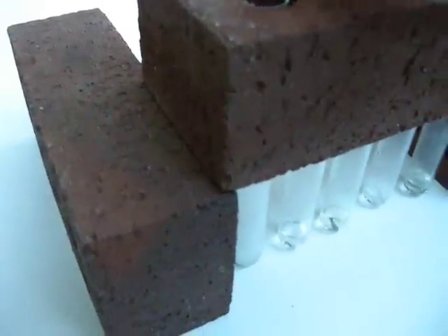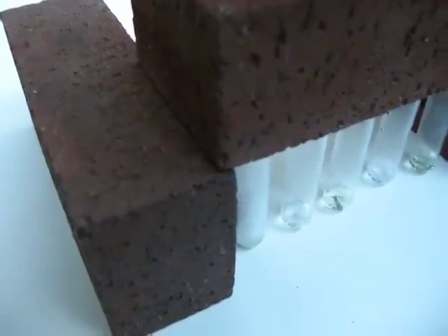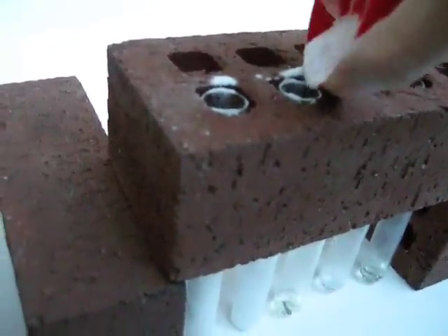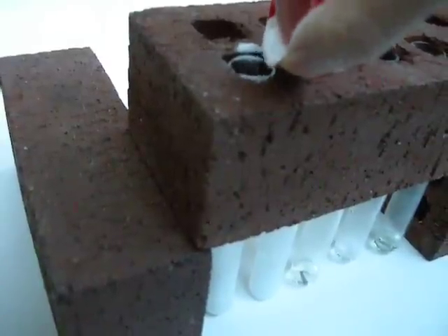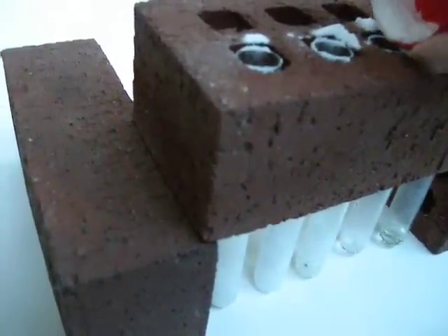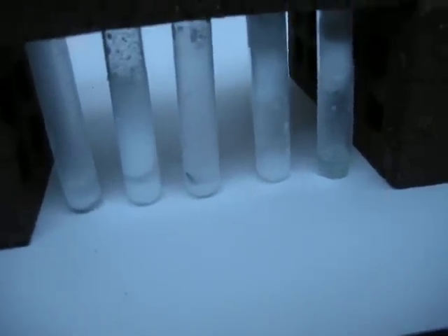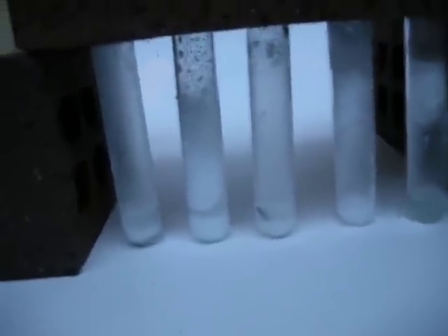I wish I had a spoon for this. I was just going to keep fizzing. I'm just tipping that in there, not really trying to be delicate about it. You want to keep adding baking soda until it stops fizzing. We've made ourselves a mess. I need to do a little bit of rotating because the baking soda is sitting up top, foaming. And that's kind of it.